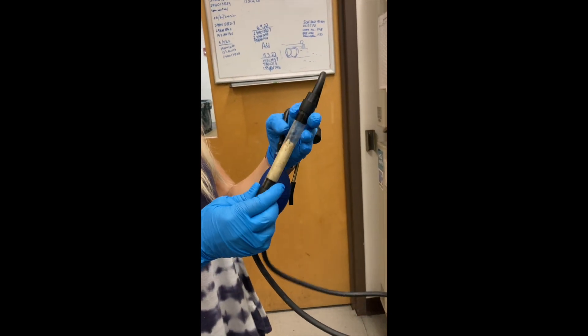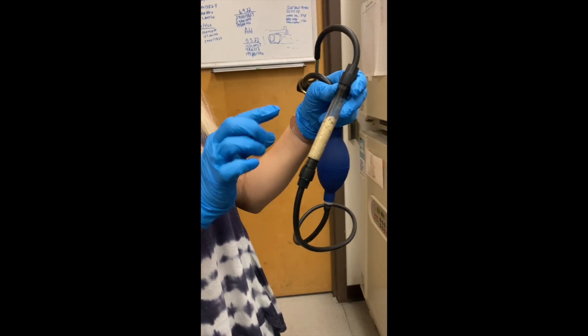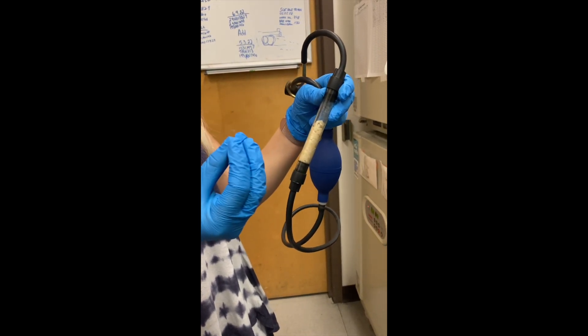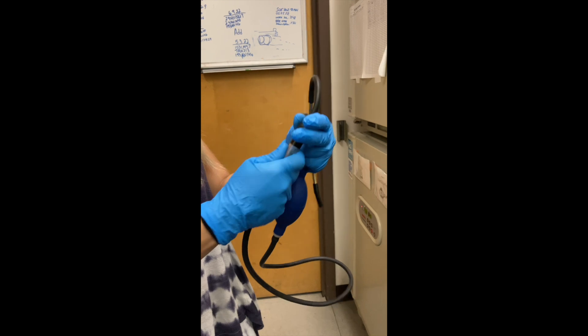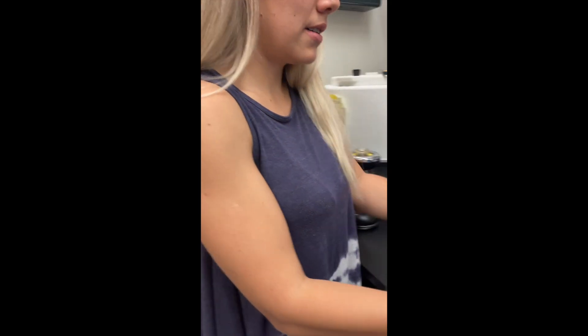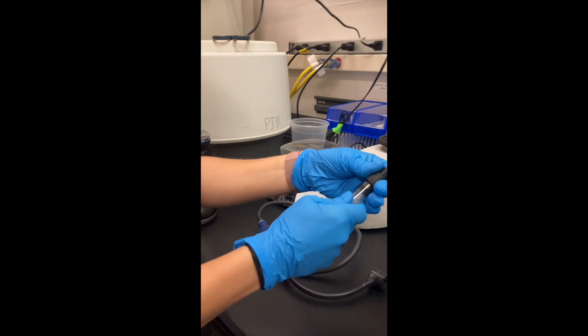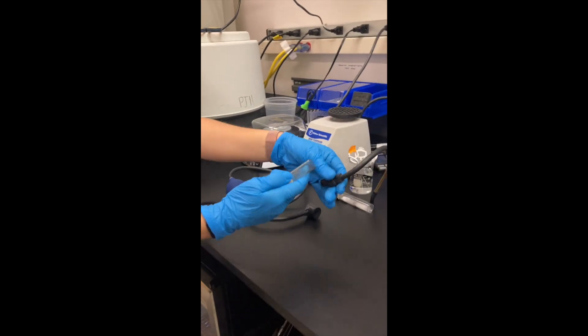And then you need to make sure this is just like moisture. So you can, let's look here. So you can take this out.